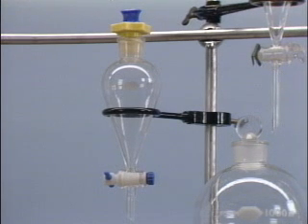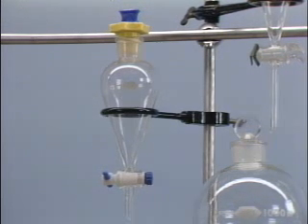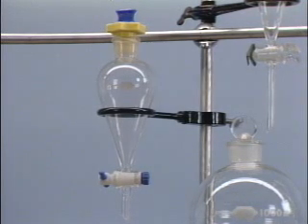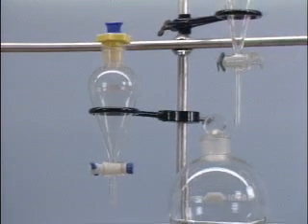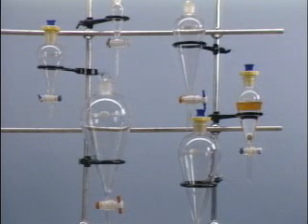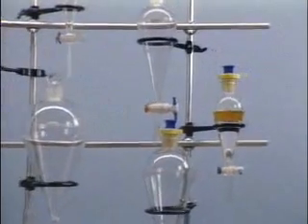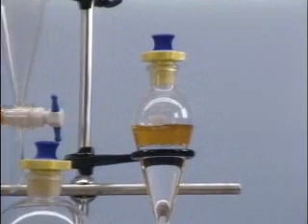Extractions are often carried out in the laboratory using a separatory funnel. This pear-shaped funnel is closed at the bottom with a stopcock, and at the top by a glass or plastic stopper. The narrow neck of the funnel at the bottom helps to separate the two phases at the meniscus. The funnel's size should be chosen so that the combined volume of the solution to be extracted and the extracting solvent fills the funnel 1/2 to 2/3 full. The airspace that remains is necessary to make sure the layers are broken up and dispersed when the mixture is shaken.